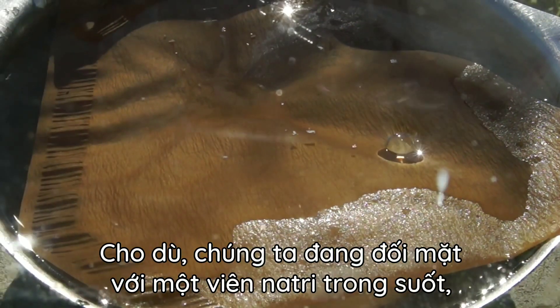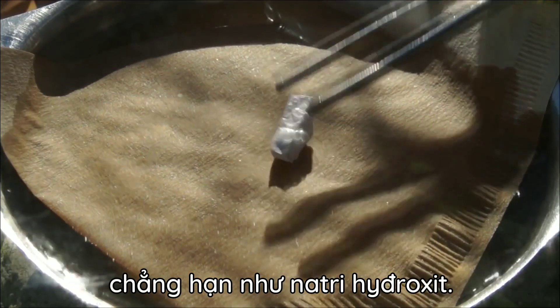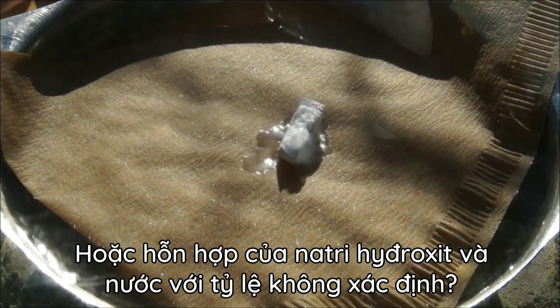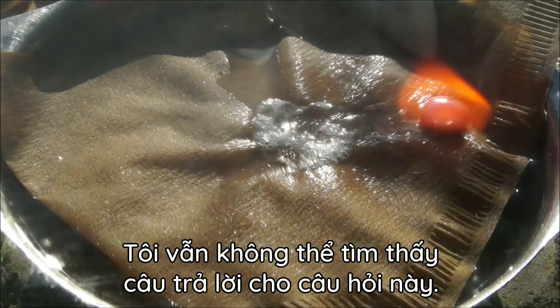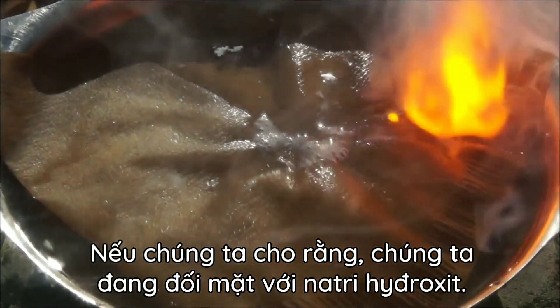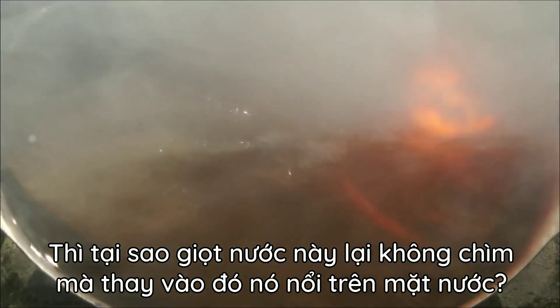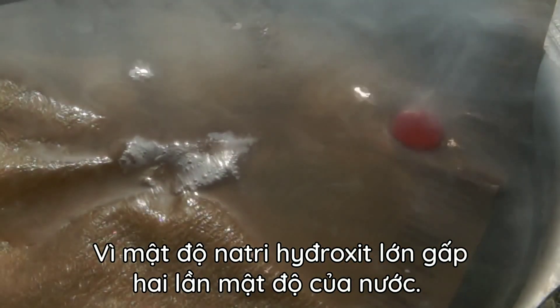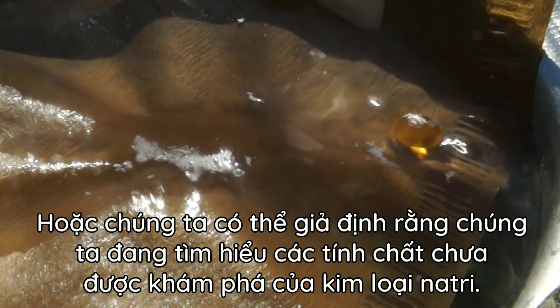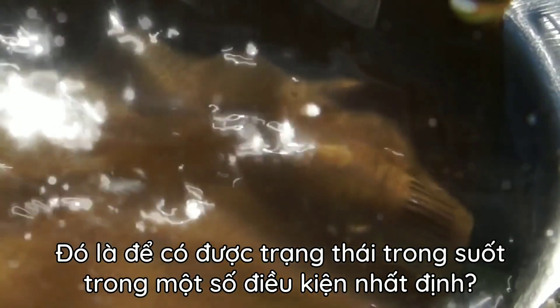Whether we are dealing with transparent sodium, or whether another substance was formed — such as sodium hydroxide or a sodium hydroxide mixture with water in unknown proportions — why does the droplet become perfectly clear? I still cannot find the answer. If we assume that we are dealing with sodium hydroxide, then why does this droplet not sink but instead float on the surface of water, given that the density of sodium hydroxide is two times greater than the density of water? Or perhaps we are dealing with undiscovered properties of sodium metal — the ability to acquire a transparent state under certain conditions.